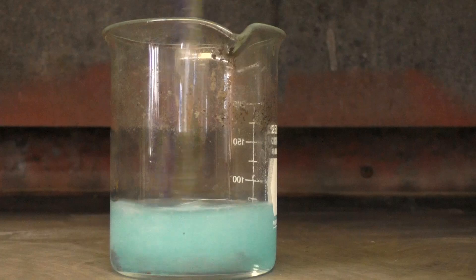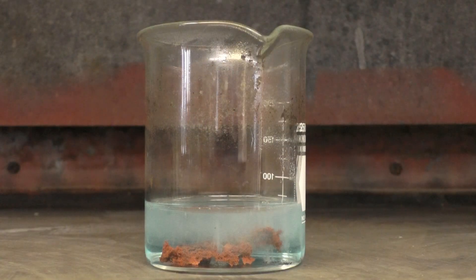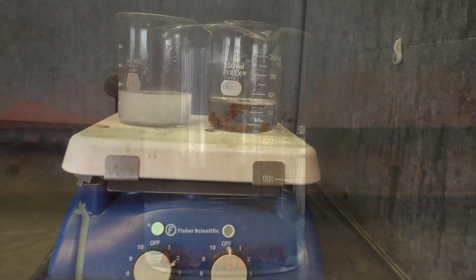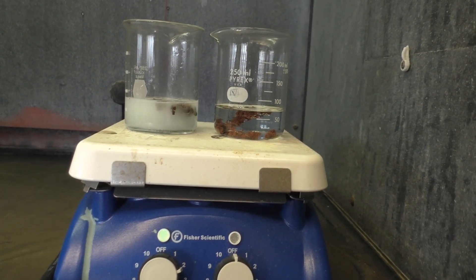If your reaction stops bubbling and your solution is still blue, don't panic. Just add more zinc. If you still have bubbling, you need to ensure complete reduction of your copper by simply heating your reaction gently in a hood.